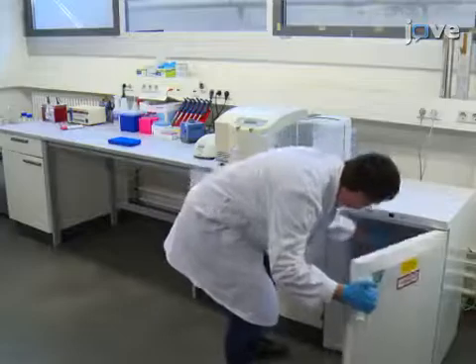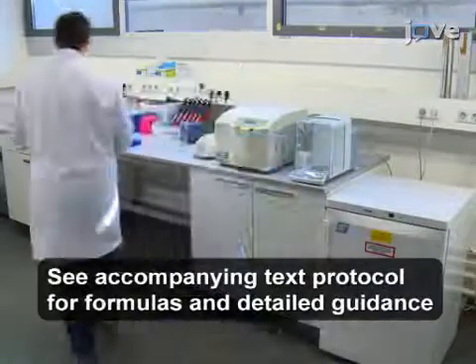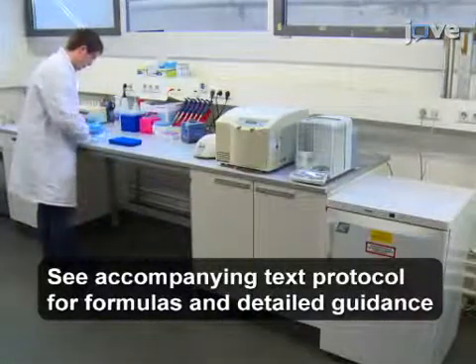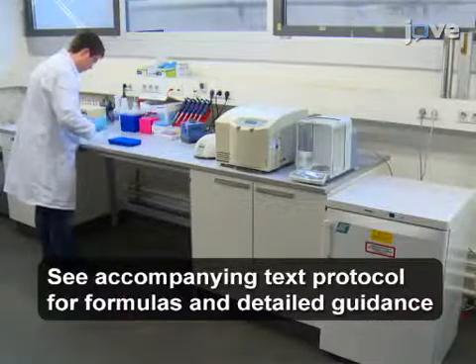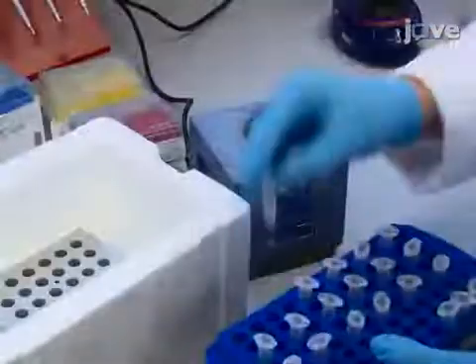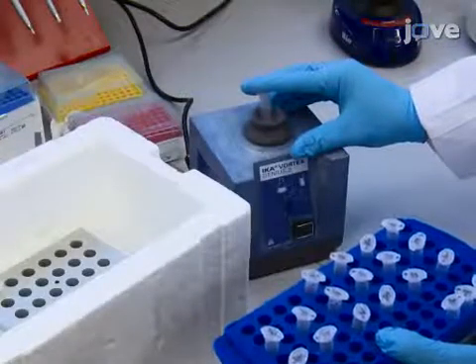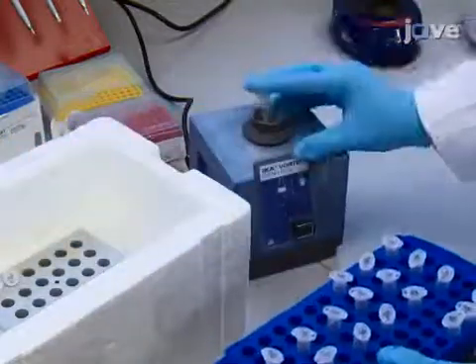To begin the experiment, thaw stock solutions of the 20 canonical amino acids, or CAAs, and the previously prepared non-canonical amino acid stock solution, or NCAA, at room temperature. Once the solutions have thawed, vortex them frequently to re-dissolve precipitated amino acids and place the amino acids on ice.